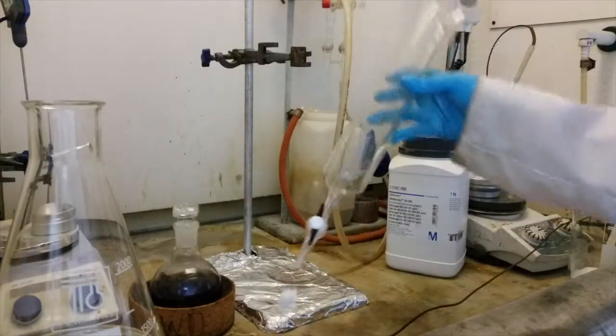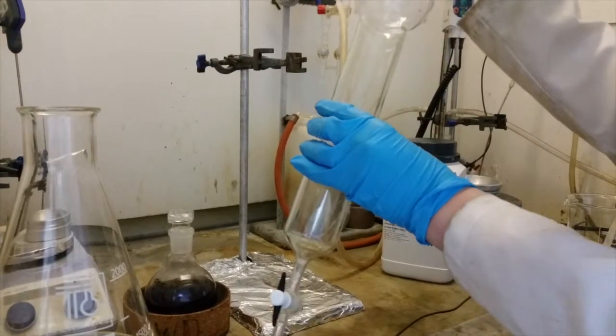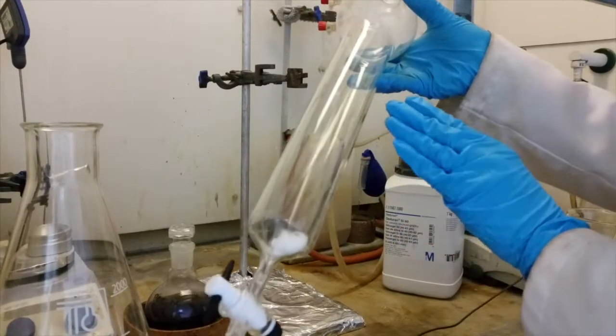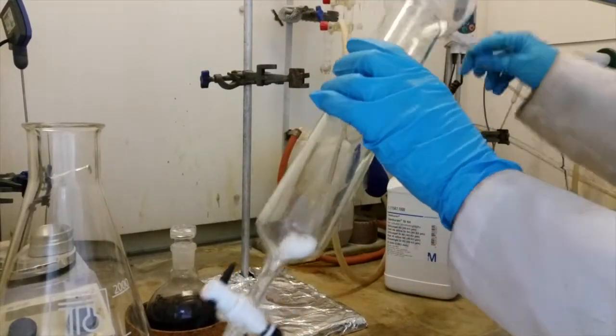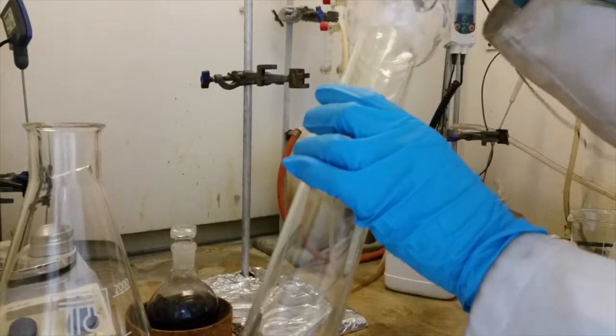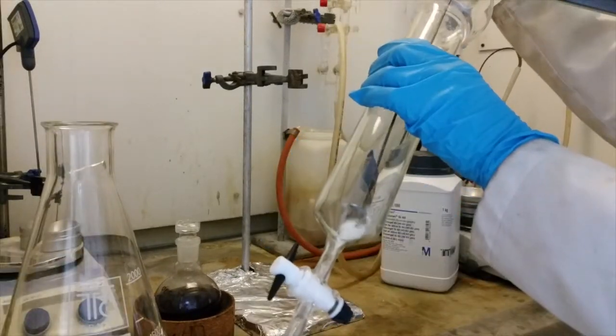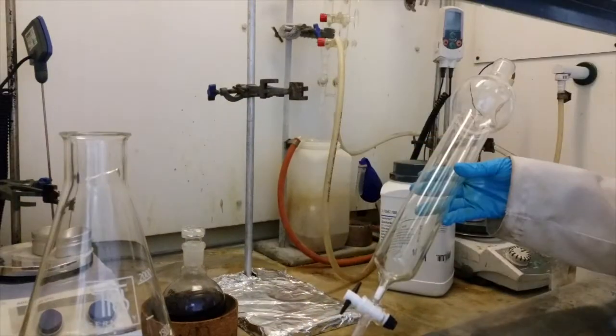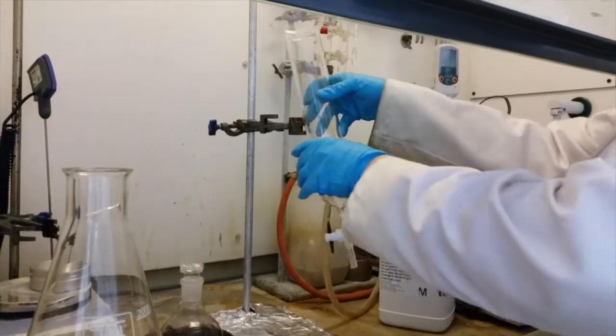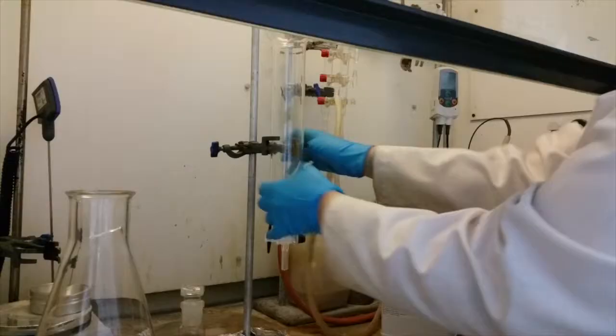Begin by plugging your column with the cotton wool. Drop the cotton wool into the column and poke it down utilizing Clive until it nestles just above the tap. Clamp the column securely on a clamp stand utilizing at least two clamps to do so.